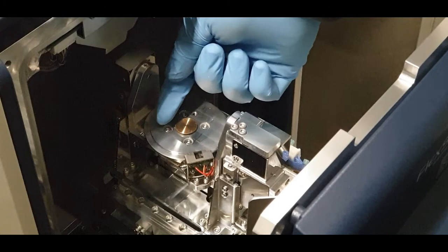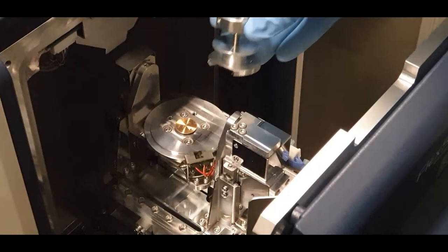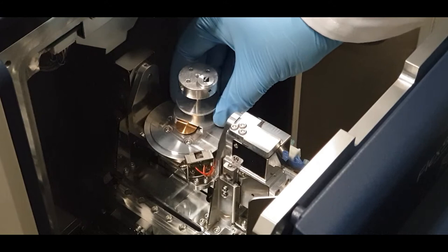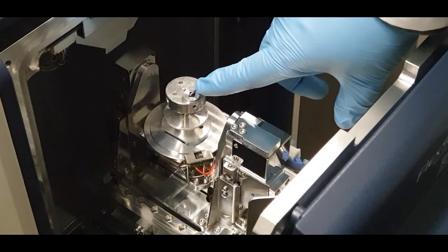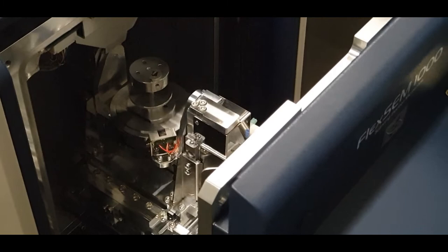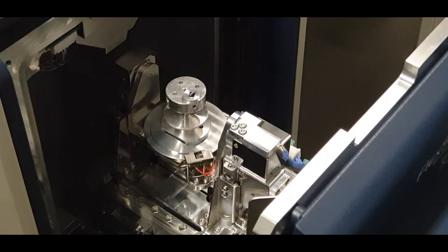On the stage itself, you will see a copper disc that is spring loaded and a flat surface. Align the flat surface of the sample holder with the flat surface of the stage, and slide the dovetail fitting across the copper disc. Come from this side, slide it into the disc, and gently push until the two flat surfaces are mated. Then check that you have correctly set the sample height by moving the stage slowly in towards the instrument and watching the height checking gauge — your sample should move beneath the gauge without contacting it. If it makes contact, remove your sample and remount it.